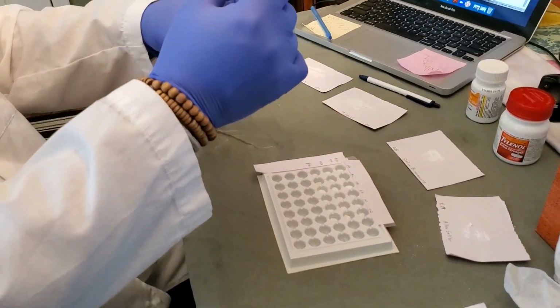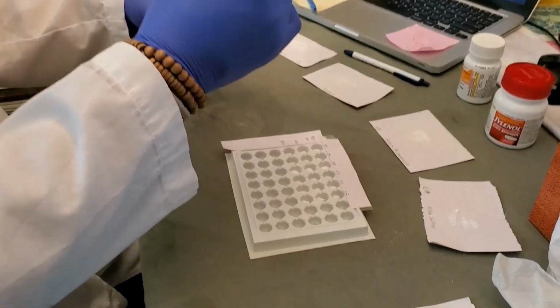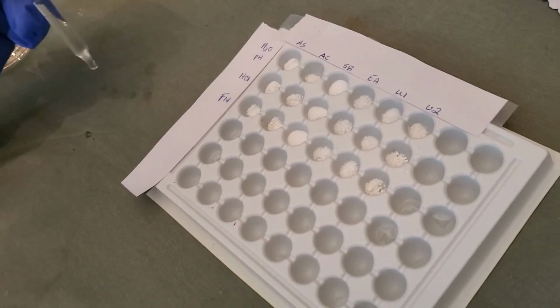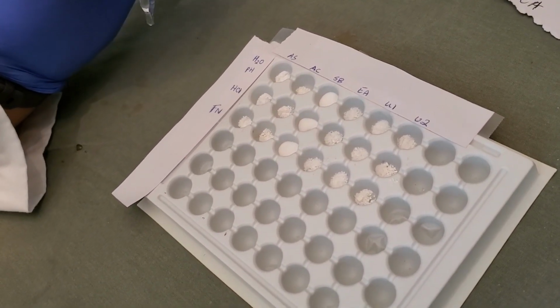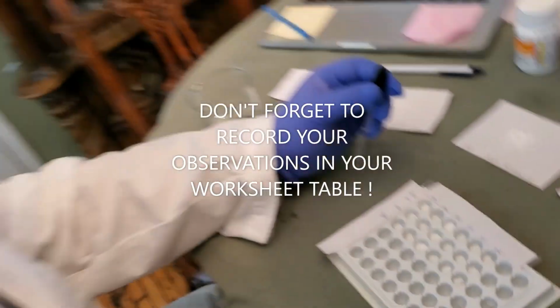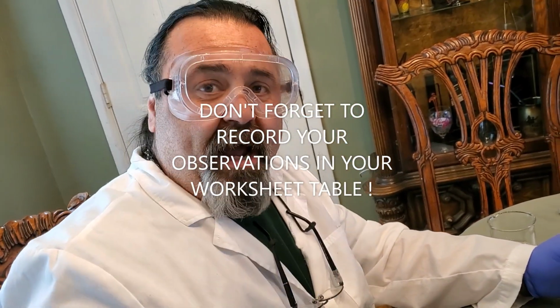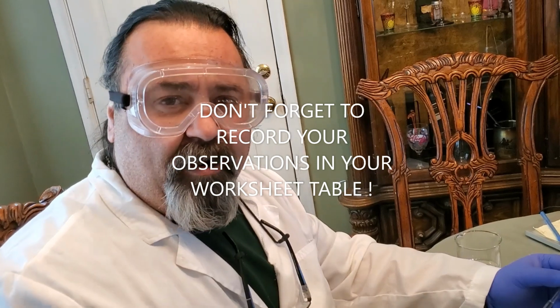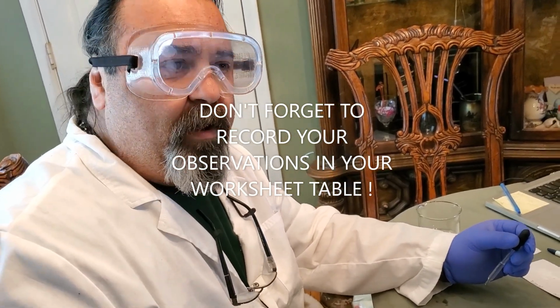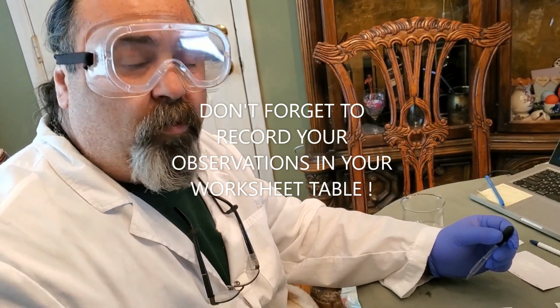Just a little drop of water in each one. And I want you to zoom in on that if you can. Then watch the reactions with each one and make observations. Observations could include no reaction, which you would write as NR, or no color change, or any kind of color change you might see, any kind of bubbling or fizzing, or nothing at all.